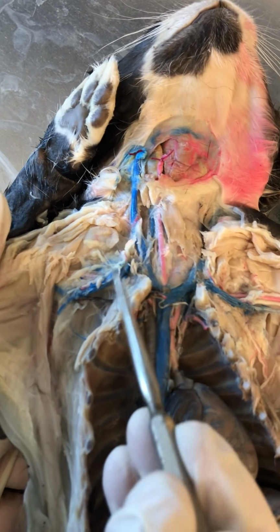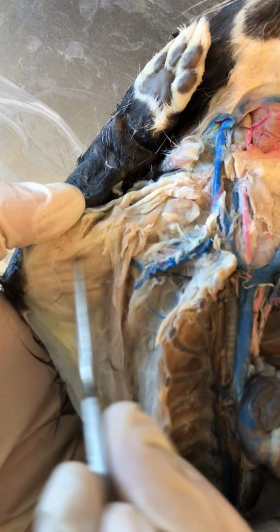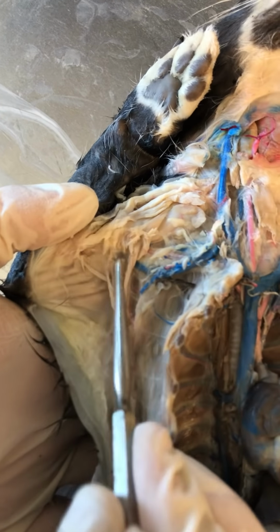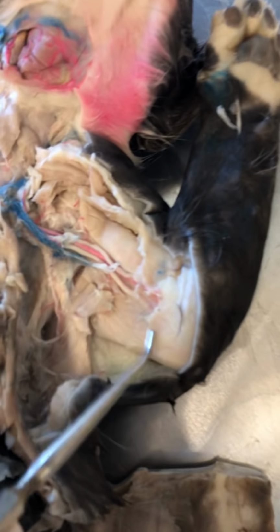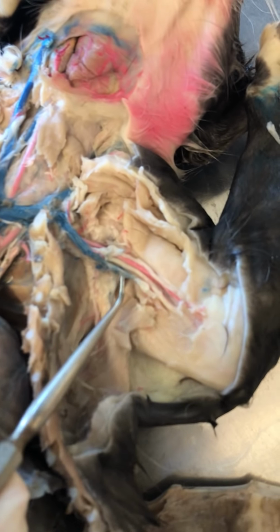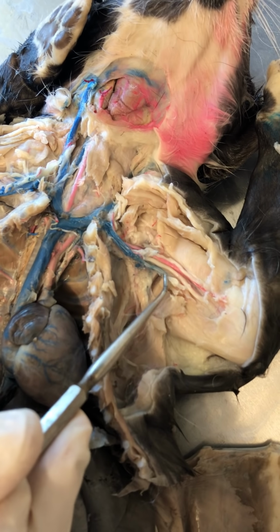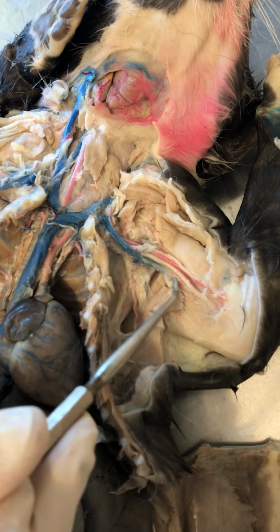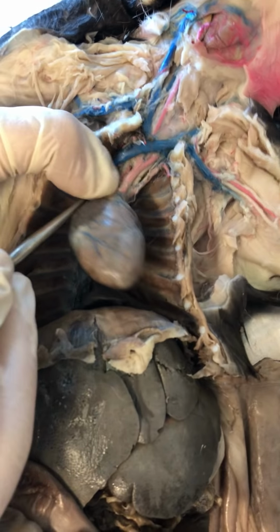off of it. Nice. My subclavian vein is going to become the axillary here at the armpit, and then if I went further deep into this tissue in the arm, this would be brachial up in here. Okay, on the other side you can see it, but it's lost the dye. Okay, see that? See how it's started to lose the dye, but still it's subclavian. Right here it's axillary, but then further in the arm, right in here, it's brachial. Okay. Nice. So now for the arteries.